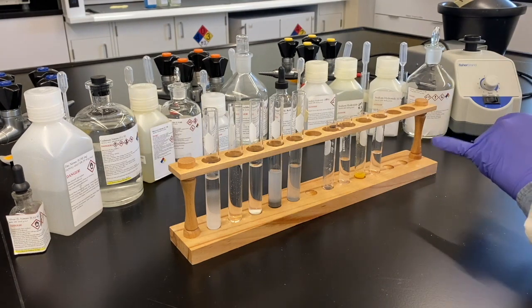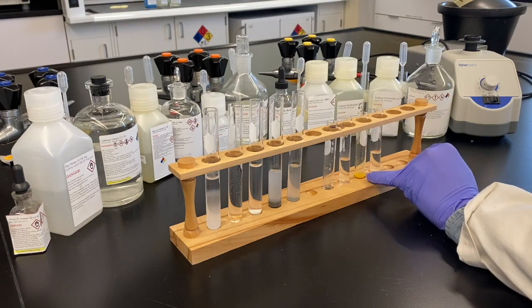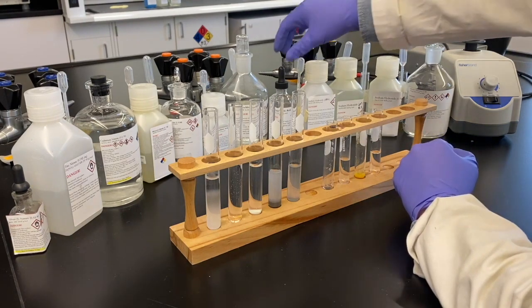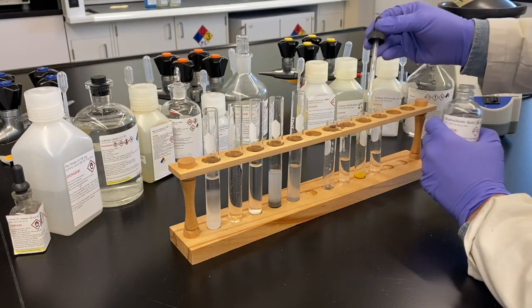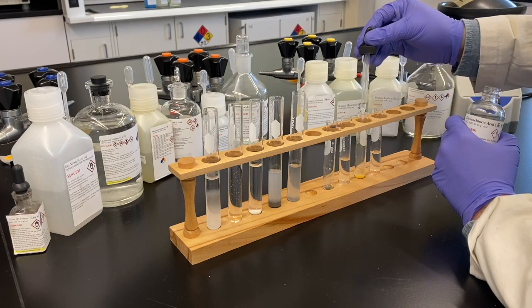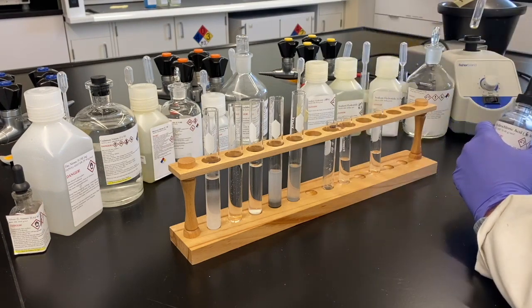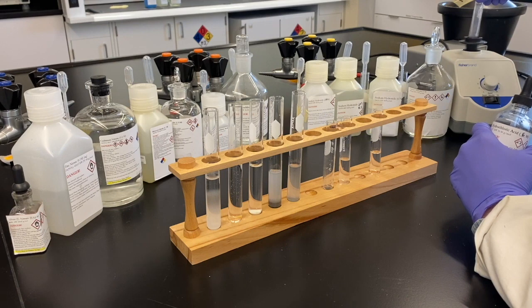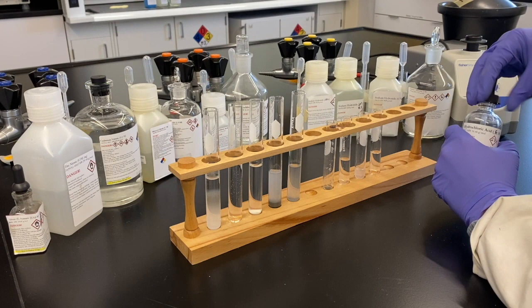So we're going to focus our efforts then in the orange test tube on the left here. We're going to have to add acid to redissolve it, and then add our tin chloride to see if we get another precipitate, but remembering that we could also have both the species that formed a precipitate, the mercury species, mercury 2, or we could have the cadmium, which did not form a precipitate in this last step, addition of acid and addition of tin chloride.